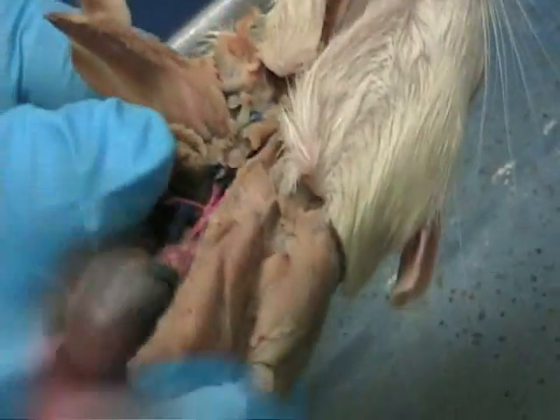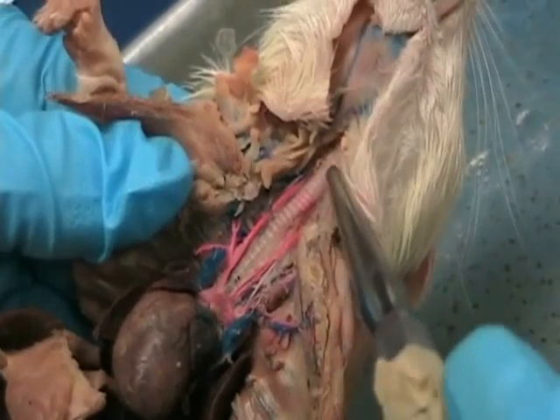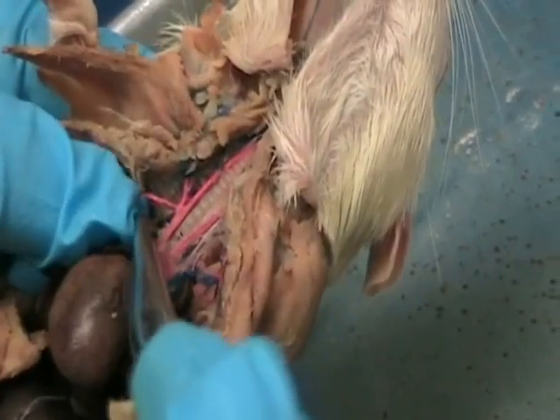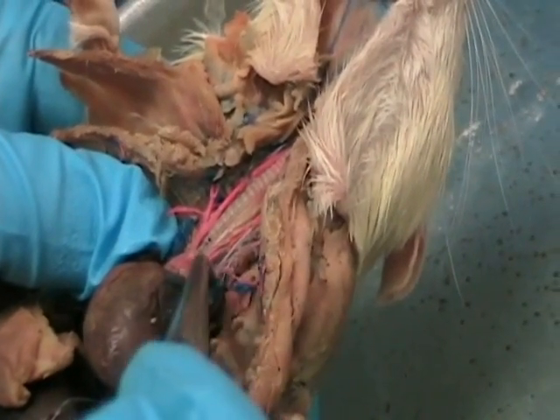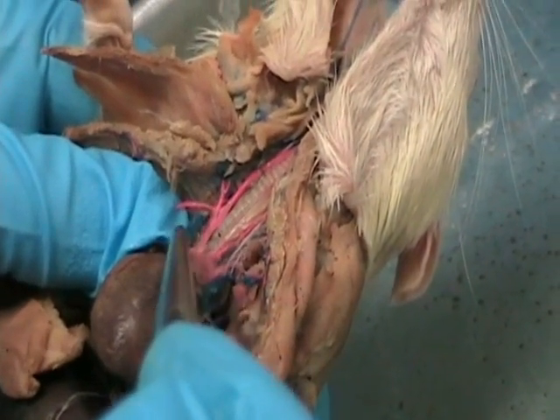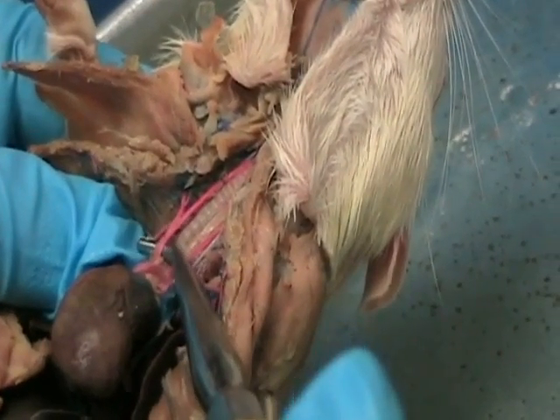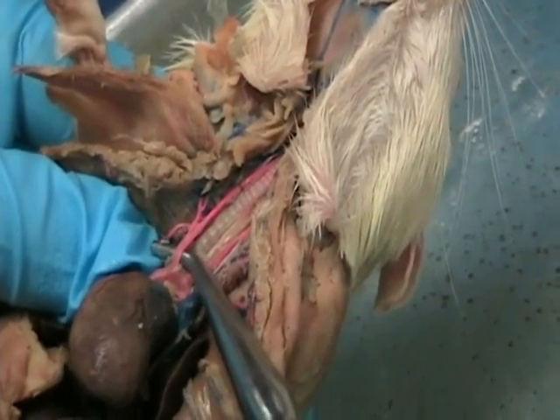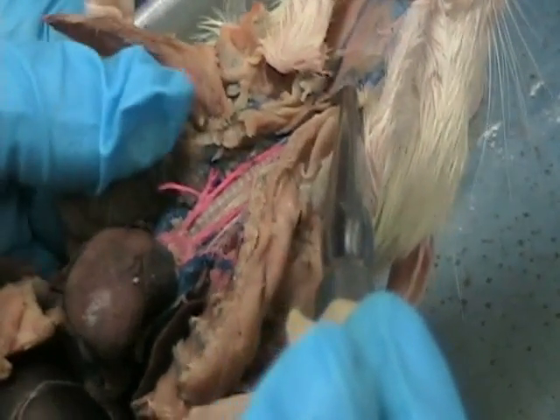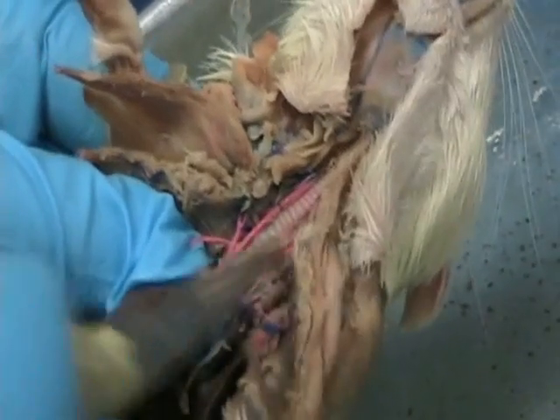Okay? Now, off of the ascending aorta, it should be symmetrical. You would think, you can see how this is symmetrical with this one. Here's one that's symmetrical with this one, and it is fairly symmetrical. The only difference is these two come down to meet the aortic arch. These two meet each other before they meet the aortic arch. And that little part where they meet is called the brachiocephalic trunk. Because part of it's going to go to the arm, brachio, part of it's going to go to the head, cephalic. Okay? Brachiocephalic trunk. Other than that little meeting right there, that should be exactly symmetrical with this side.